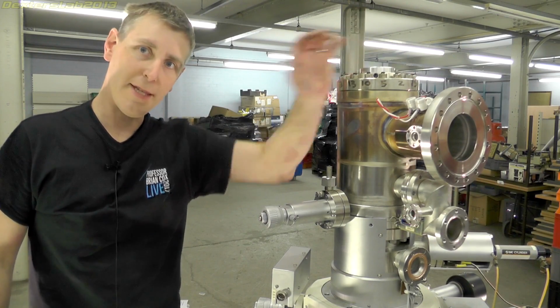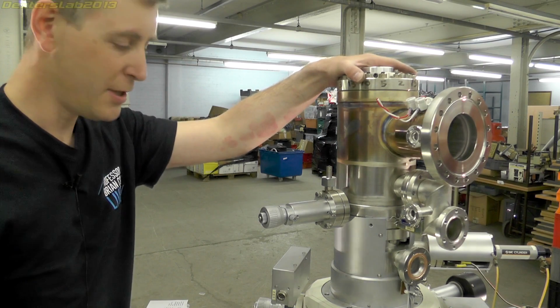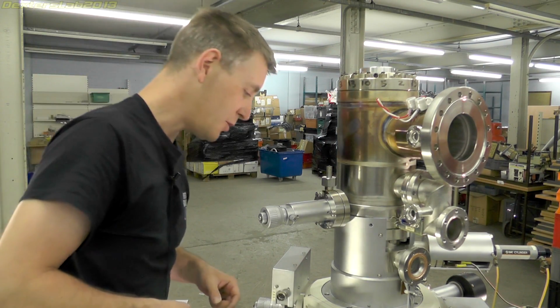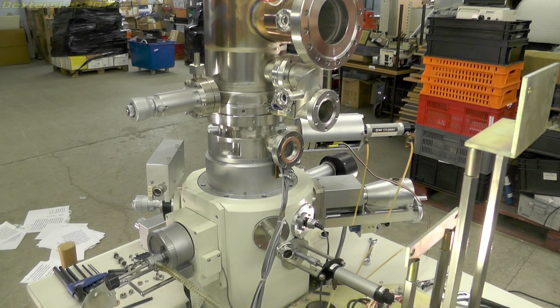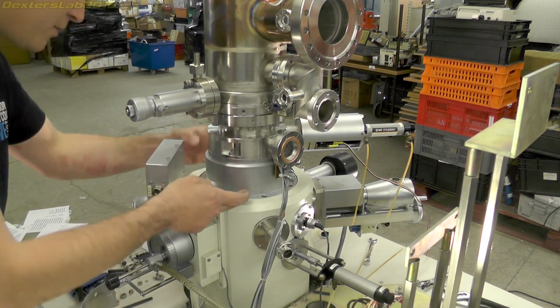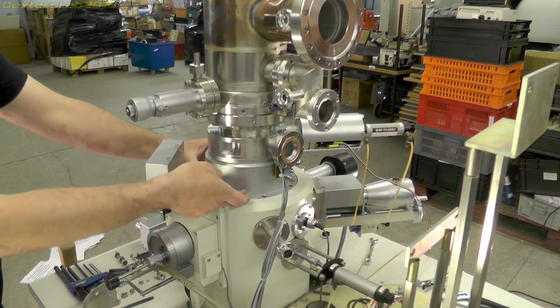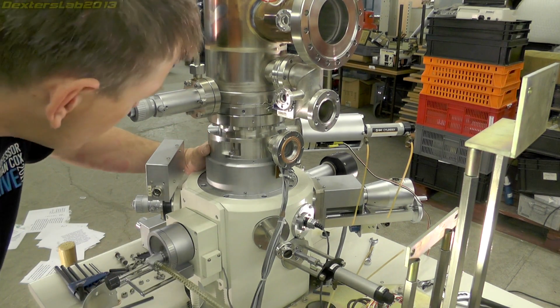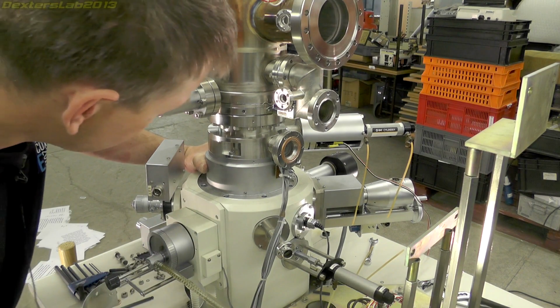Right, I can't seem to get this off. I'm not quite sure what is holding it in. It's definitely loose, but it just doesn't want to come off. So I'm not entirely sure what I can do now. And I have seen there's one, two, three, probably four or five set screw Allen bolt things on this. So I'm just gonna try slackening those off just to see whether that does anything.